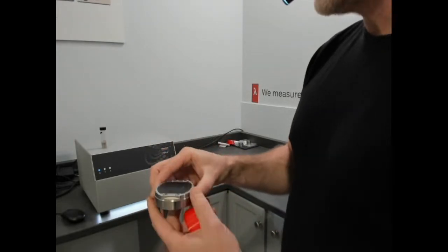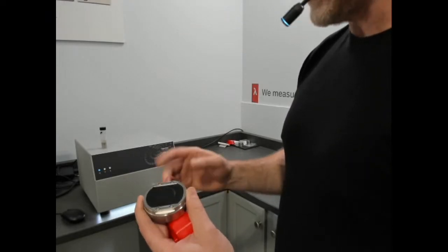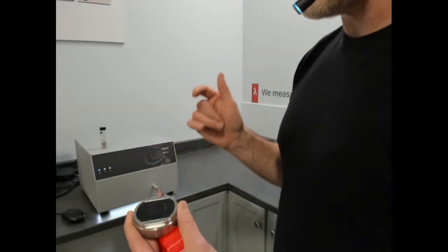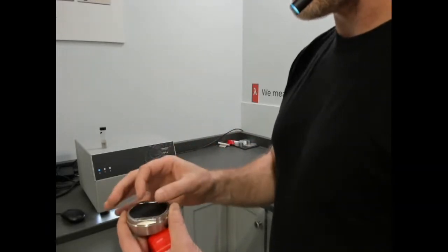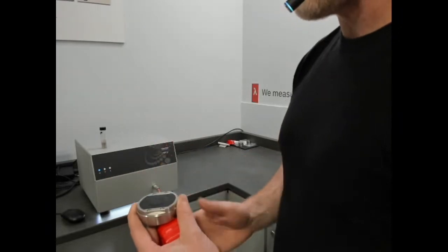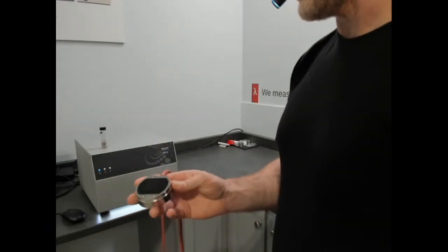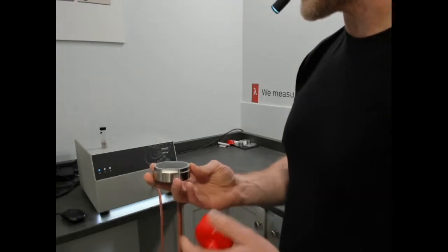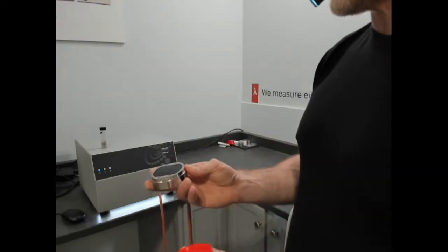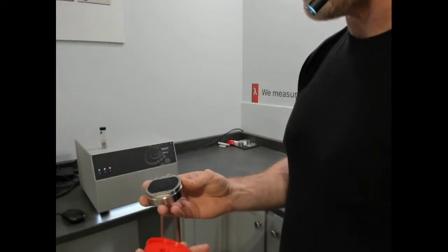Now this one has an additional standard that it follows for thermal effusivity, ISO 22007-7, and that's for measuring one-dimensional and three-dimensional thermal effusivity. We'll be doing more discussions on that. So this is the only asymmetric or single-sided sensor, or absolute MTPS sensor, modified version, that follows that standard.